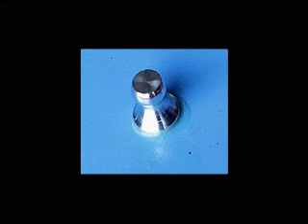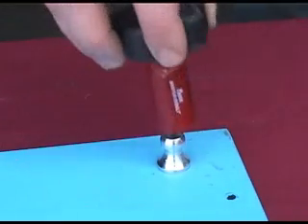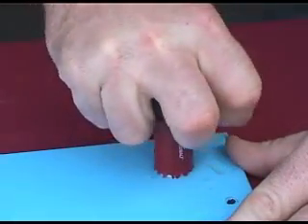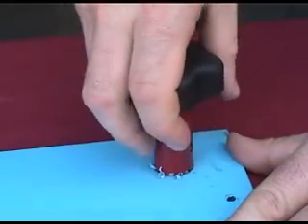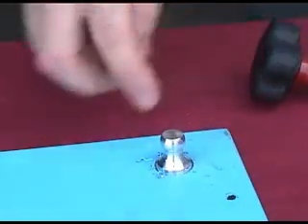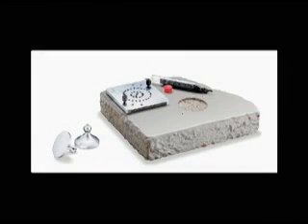After proper cure time, the operator must decide whether or not to cut the coating around the dolly. As a minimum, any excess epoxy that appears during the curing process should be carefully cut away to prevent an increase in the pull-off area. A common method is the use of a cutting tool with an inside diameter matching the dolly size. When deemed necessary to cut through a coating to relieve unwanted lateral bonding stresses, the method utilized should minimize the induction of surface flaws such as micro-cracking. Such flaws may lower test results and create fracturing resulting in partial pull-off results. For testing thick coatings with a 50mm dolly, an optional drilling template may be preferred to a cutting tool.